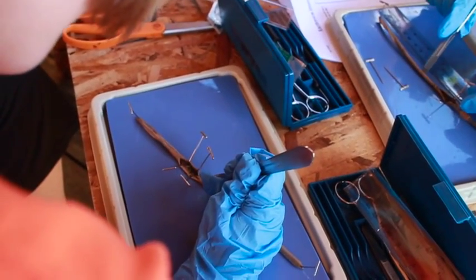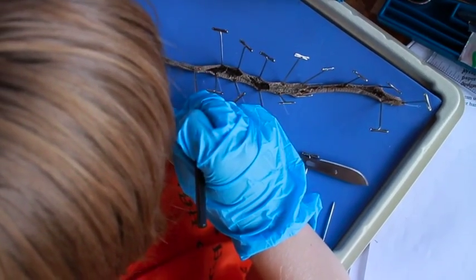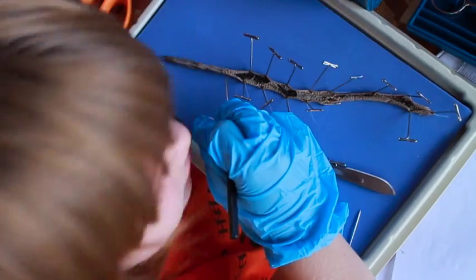Spicy, spicy, stabby, stabby — this is the main tool during dissections. This is a lot like a dental pick; at least it looks a lot like a dental pick. It looks like what I pulled my last tooth with — I stuck it behind the tooth and yanked it out. But this is what I used to pull apart the skin before sticking the pins in, so moving the skin and then sticking the pins. This was a very helpful tool, but the scalpel of course is the most helpful tool during dissection. You can't do one without it.